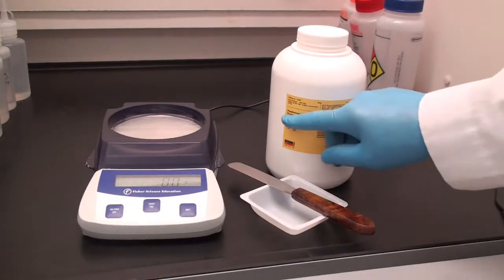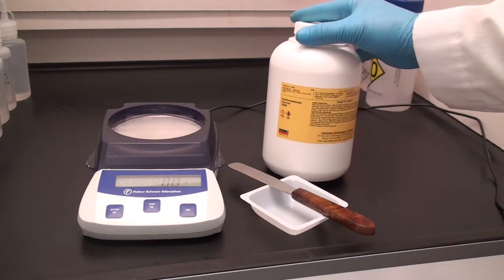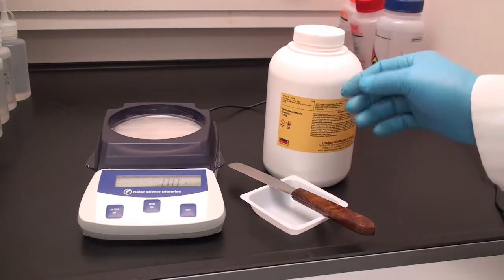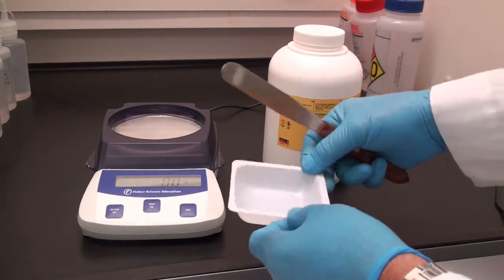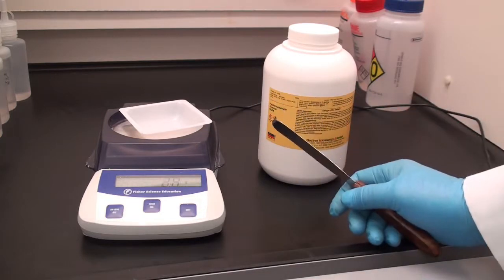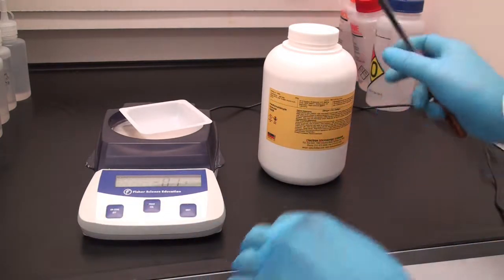While that's warming up, I'm going to measure out my paraformaldehyde. I'm using granular paraformaldehyde. We also have this in a prills method where it's a more solid form, but this dissolves quite rapidly. So I'll tare out my weigh boat and measure that out.